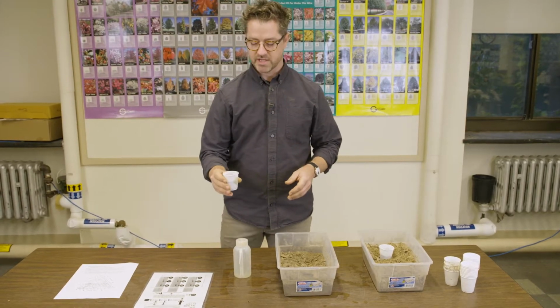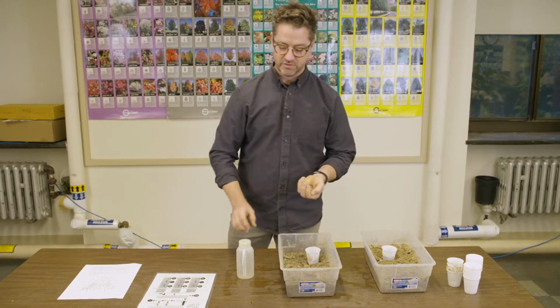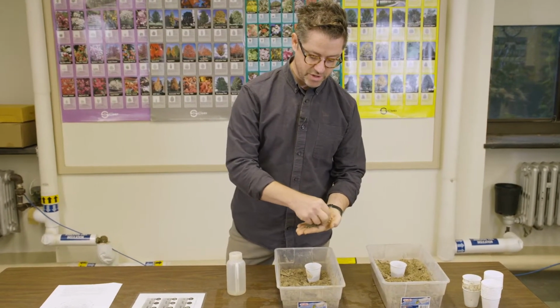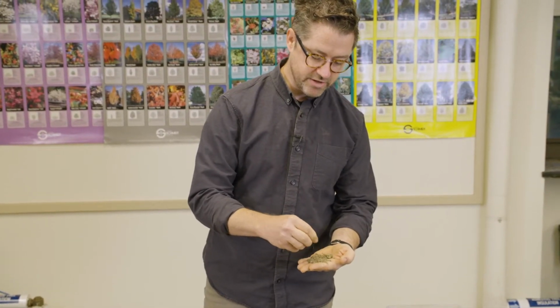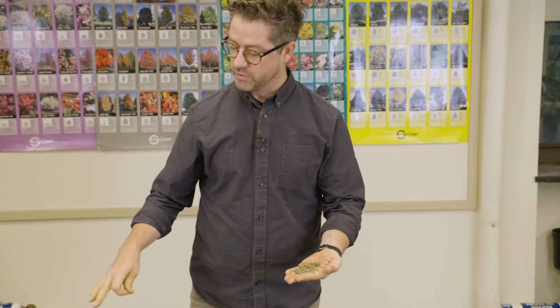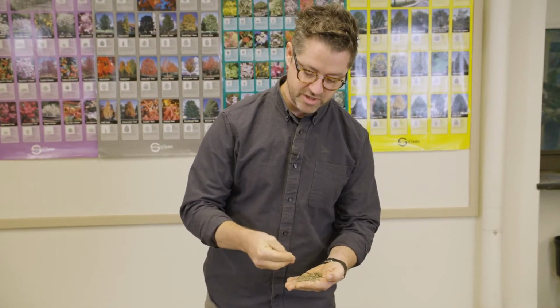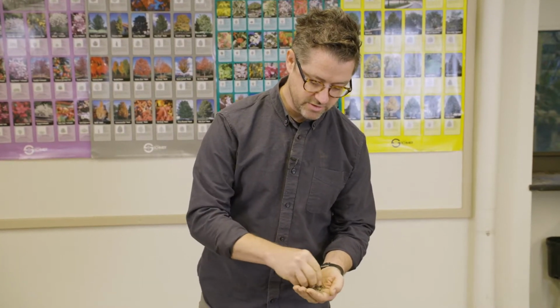It starts with taking a small amount of the soil in the hand. This is soil texture by feel, or by hand. We're going to sort the soil a little bit, removing sticks and stones, elements larger than the largest sand particle that do not form part of the overall textural composition. So I'm just pulling out the stones. Some of these are just large particles of soil that are kind of glued together. I'm just going to remove those.